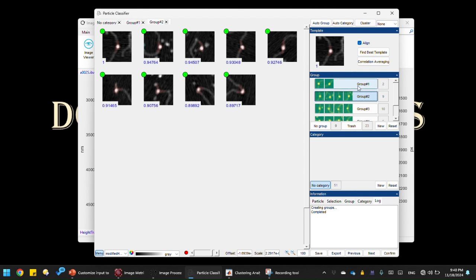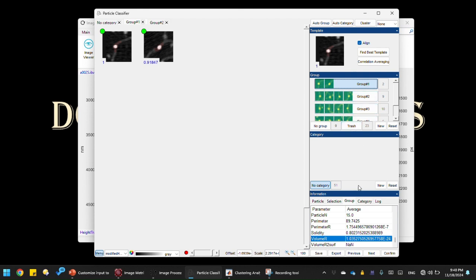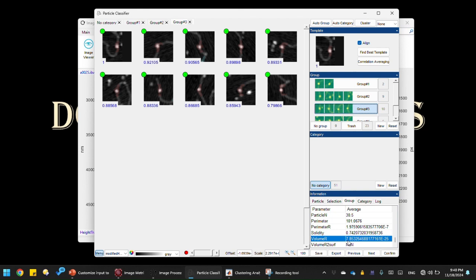We can quickly verify that by checking the parameters of each group. For instance, in group 2, if I click the information panel, I can see the volume is 952 cubic nanometers, okay? If I click group 1, that's even larger, that's 1,000 cubic nanometers. So it's actually classified them according to the size of the protein. And if we click group 3, then that's even smaller, it's 785 cubic nanometers.